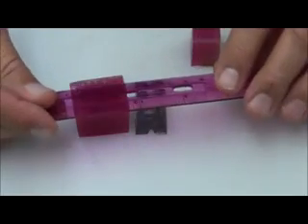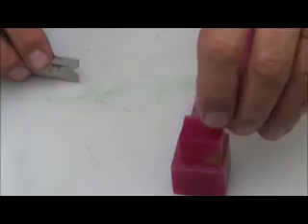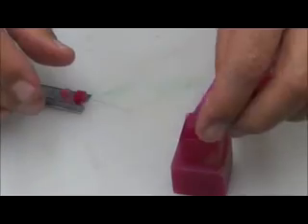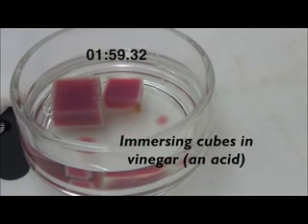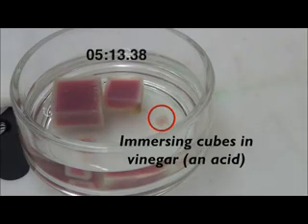I've cut cubes of this agar into 4 different sizes. The biggest is 3 centimeters on a side, the others are 2, 1, and 0.5 centimeters on a side. I'm going to put these cubes into a dish of vinegar, a weak acid. Watch what happens. In 6 minutes, the tiny cube has lost its fuchsia color and turned completely white.